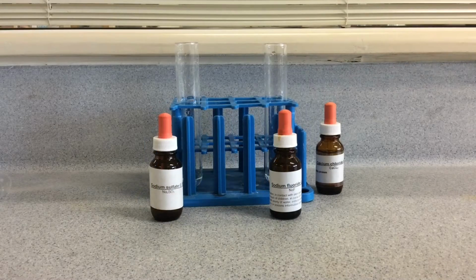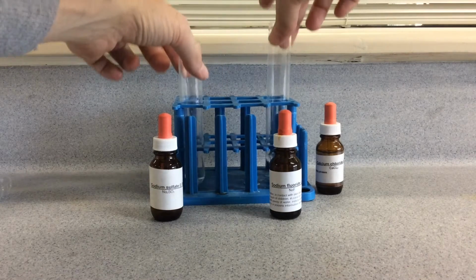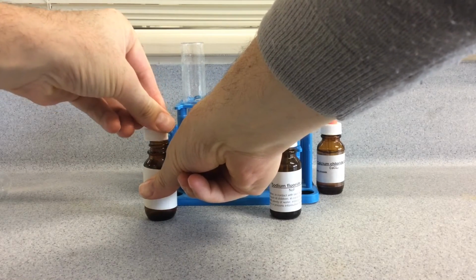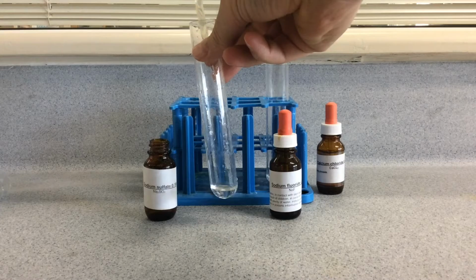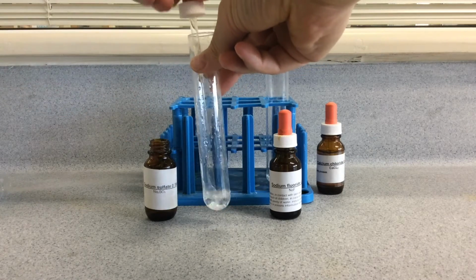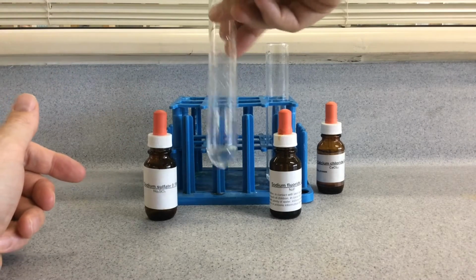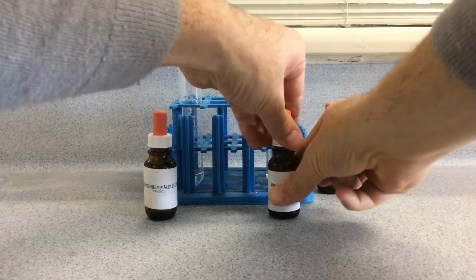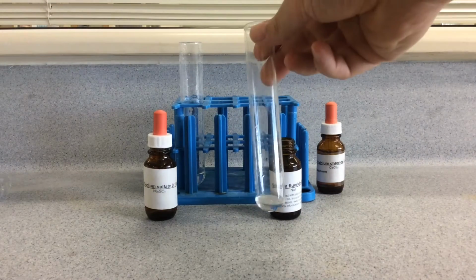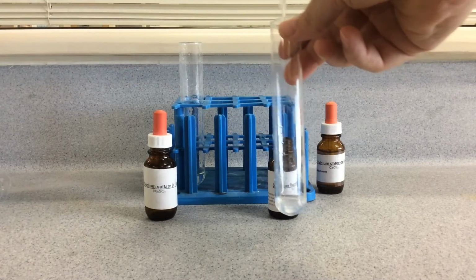The next cation to test for is calcium. So we've got calcium in these two. Once again, we test for calcium with sulfate. Just like barium, it should give a white precipitate with the sulfate. Okay, this one doesn't have a high enough concentration, so you do get issues there with concentration, just like we did with the lead. A confirmation test is fluoride ions with calcium, and this should give a white precipitate. There we go, you can see a white precipitate forming with the fluoride ions.